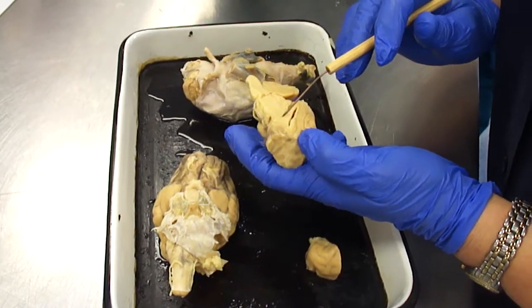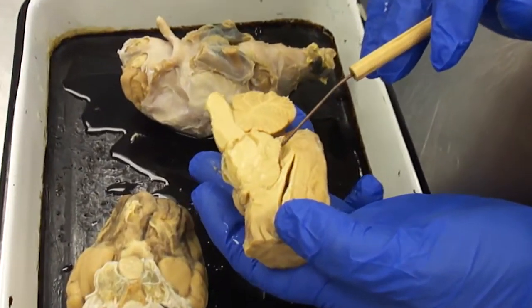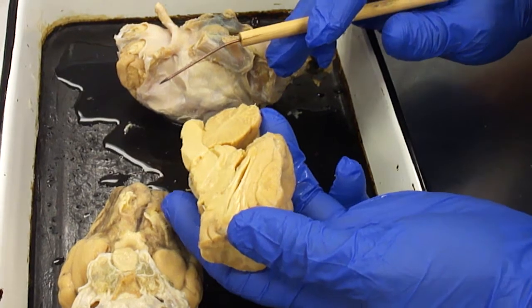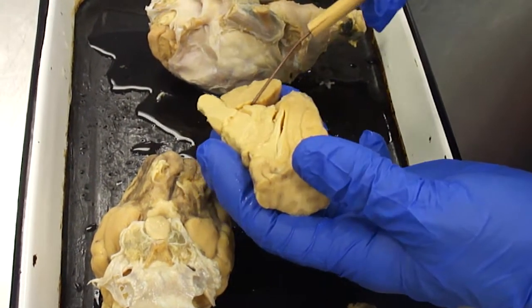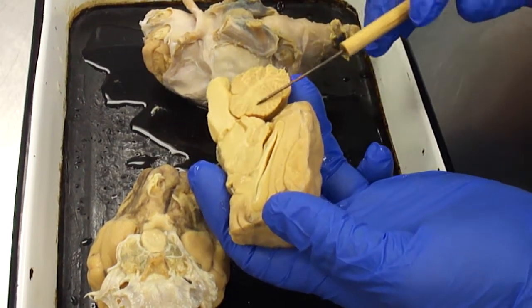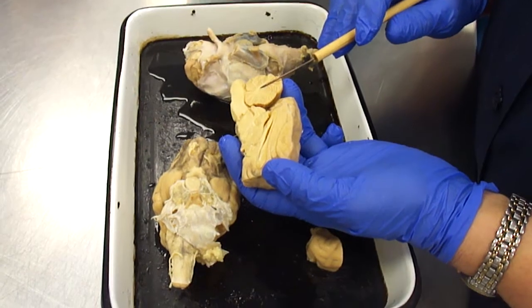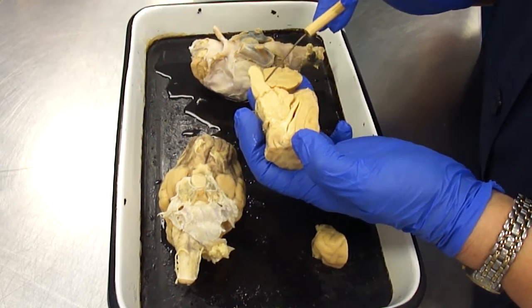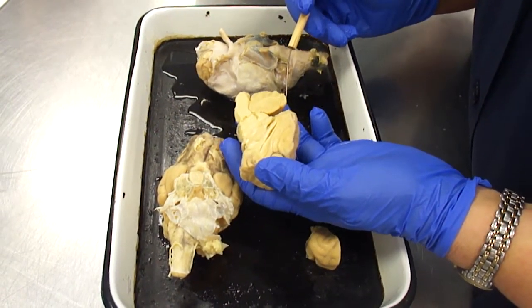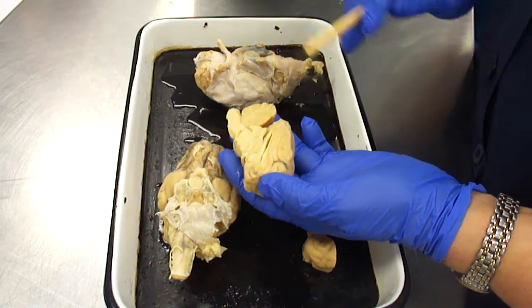Pineal body, sometimes you can see and sometimes you can't. It would be just in here. This one doesn't have one. I'm going to cut open another one for Monday and we'll see if we can see it. Transverse fissure right here between the cerebrum and the cerebellum. The pattern of the white matter and gray matter form the arbor vitae. The third ventricle and fourth ventricle are connected by an aqueduct, which I don't think I've ever labeled on a diagram, and the medulla oblongata.